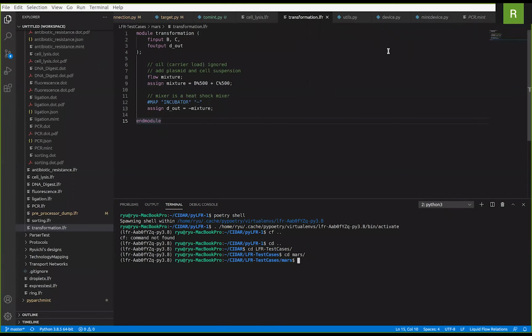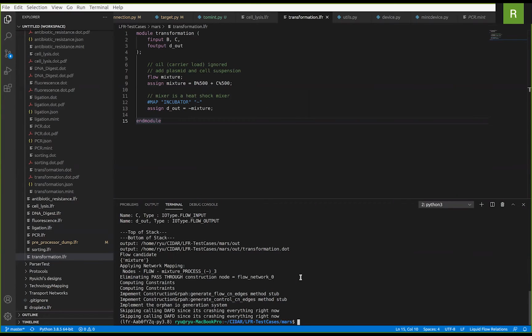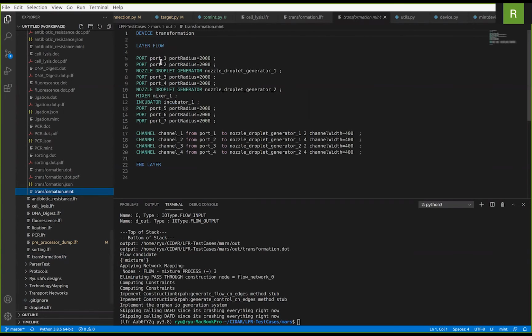This is a transformation LFR file based on design in MARS repository. And I'm going to run this through LFR compiler. And as you can see, it successfully generated the mint file for transformation mint. You can see all the parameters and channels generated. However, the channels are not 100% correct, which we will need to work on in the future.